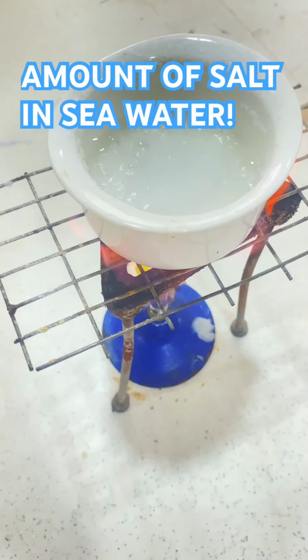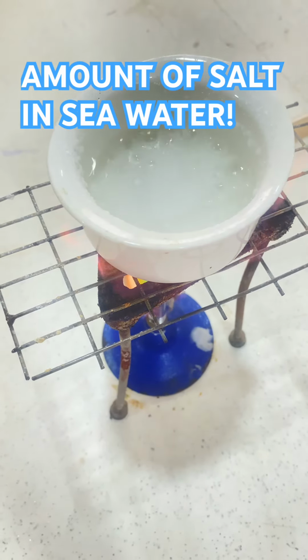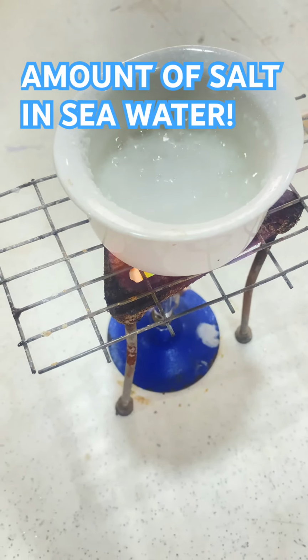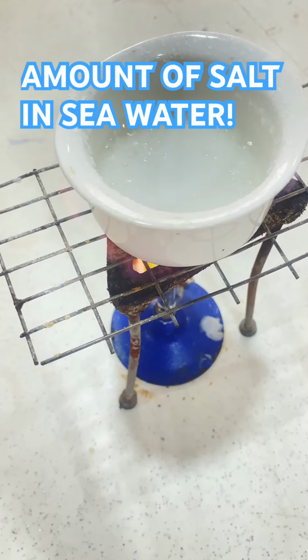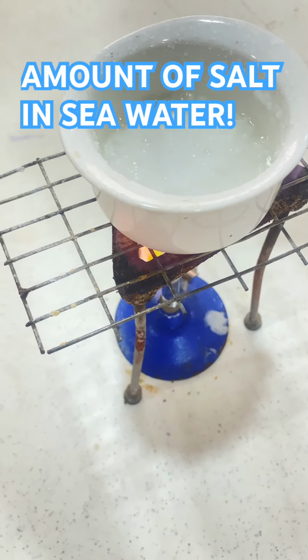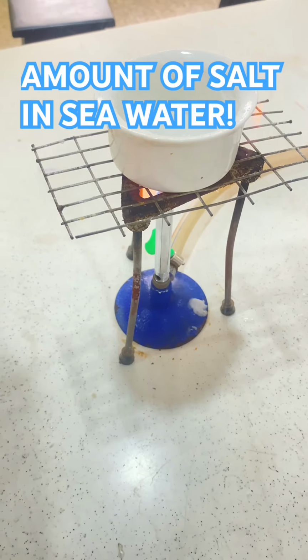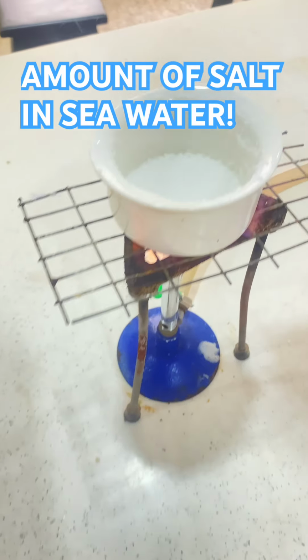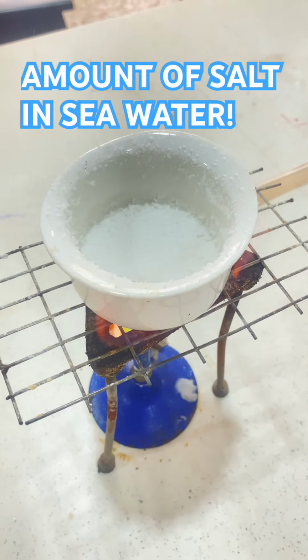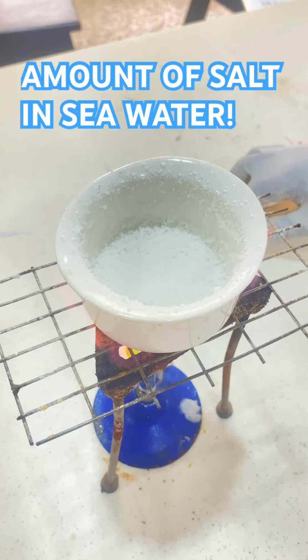Now, as you see, the salt is crystallizing. When it starts crystallizing, it will start to shoot up, so you have to be very careful not to let some of the mass of the salt formed escape. Now you can see the salt is crystallizing. Now you can see the salt has crystallized. It has finally crystallized and shot up, and that is the salt forming. We are going to weigh it back on the scale.